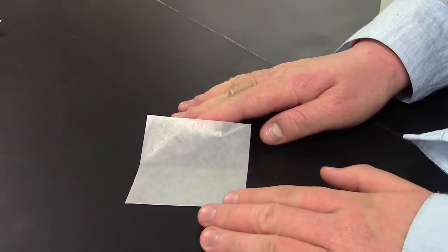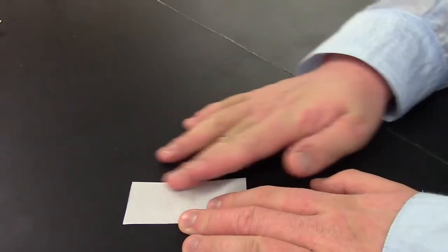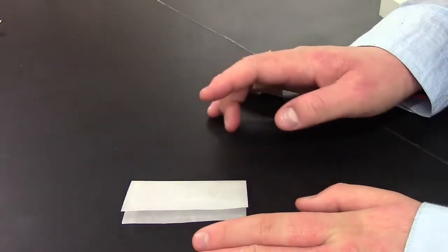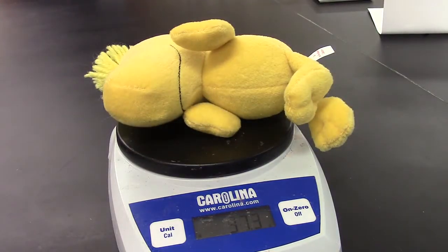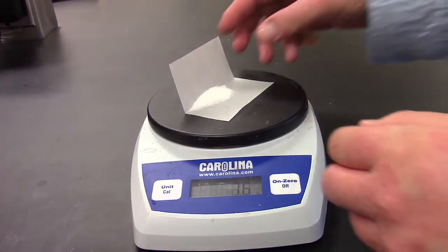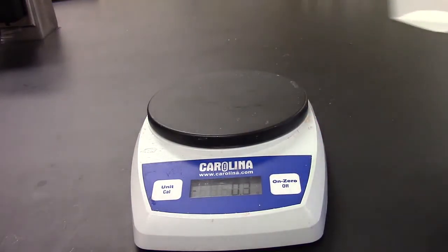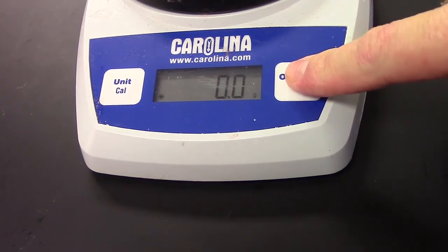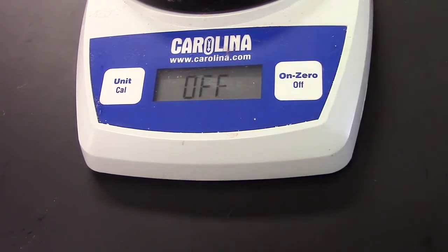If your substance requires a weigh paper, fold the weigh paper down the middle like this before you add the substance to keep it from going all over the place. Once you weigh your substance, be sure to write down all of the numbers that the scale shows. When you're finished using the scale, remove the container and the substance, then turn off the scale.